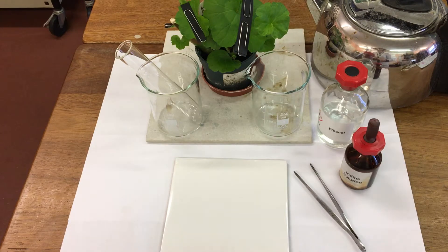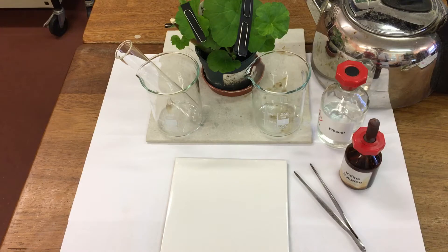In this experiment we're going to be testing leaves for starch, but this time we're going to use a de-starched geranium plant.